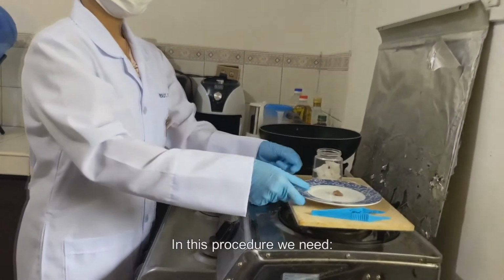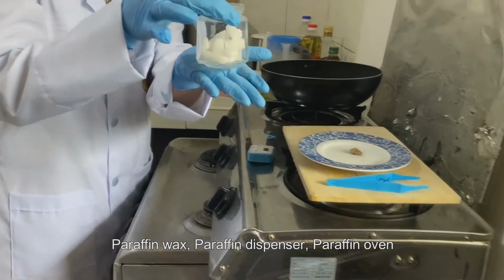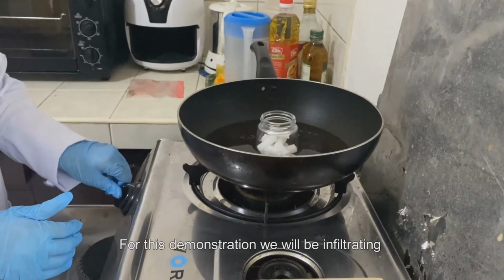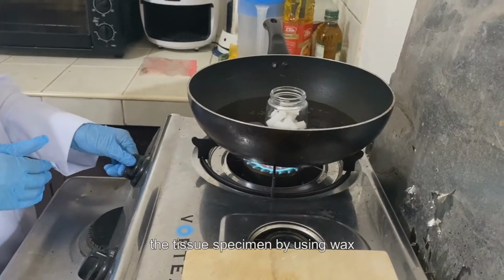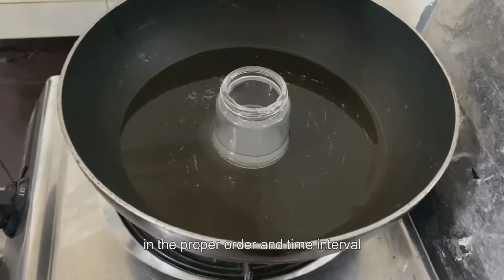In this procedure, we need paraffin wax, paraffin dispenser, paraffin oven, glass dish, and cleared tissue samples. For this demonstration, we will be infiltrating the tissue specimen by using wax. We will be immersing the tissue specimen into 3 separate paraffin wax baths in the proper order and time interval.